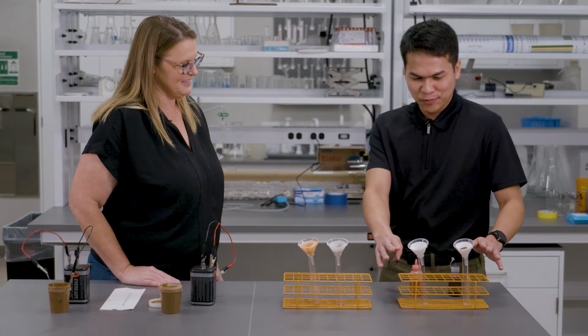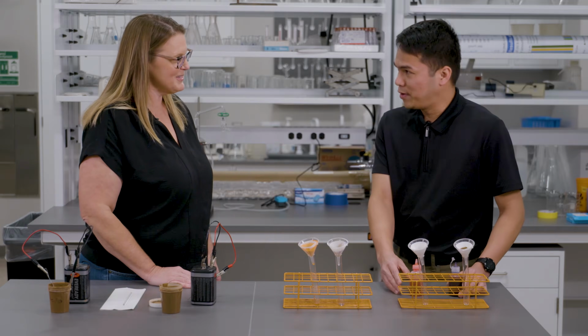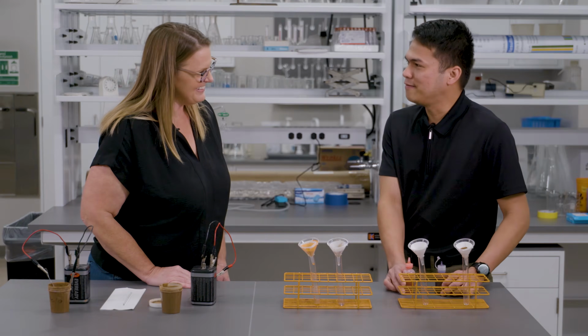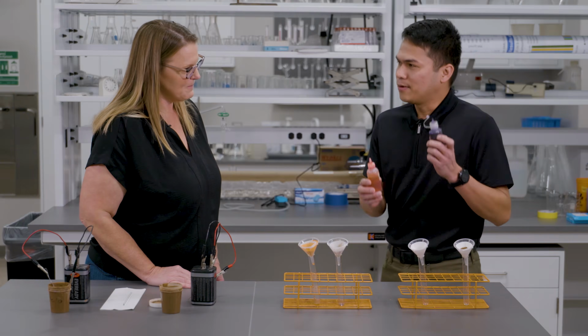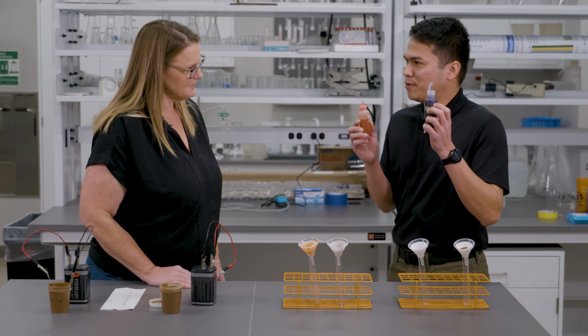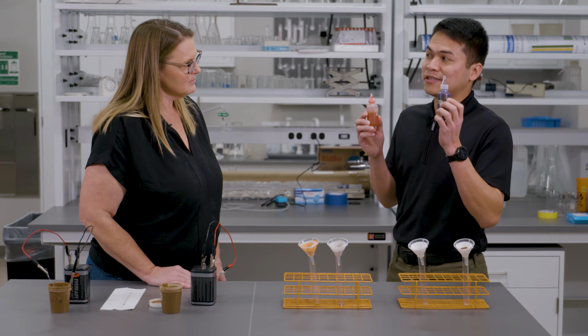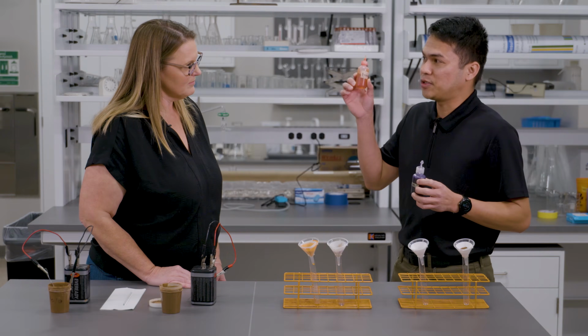Okay, the first one. So you're going to prove it for us. I will. Oh, we will, actually. The first one involves dyes. We have two dyes. A purple one, which bears ions that have a positive charge, and this one has a negative charge.